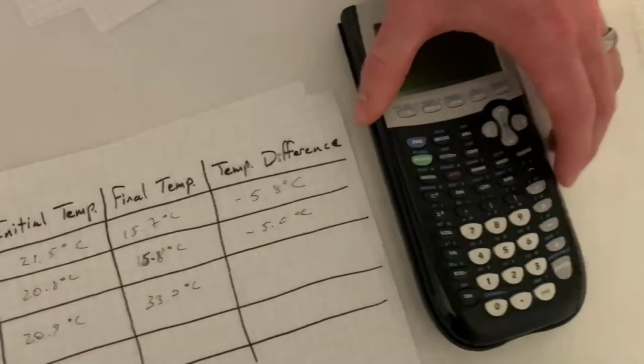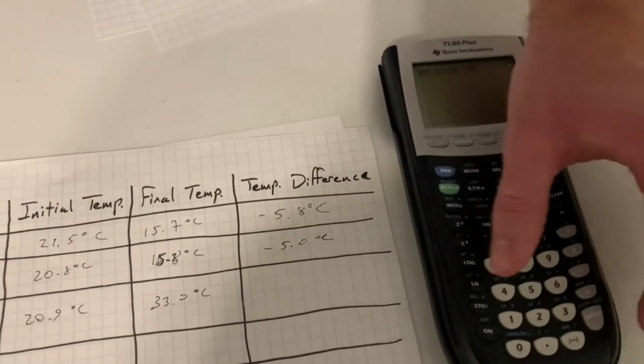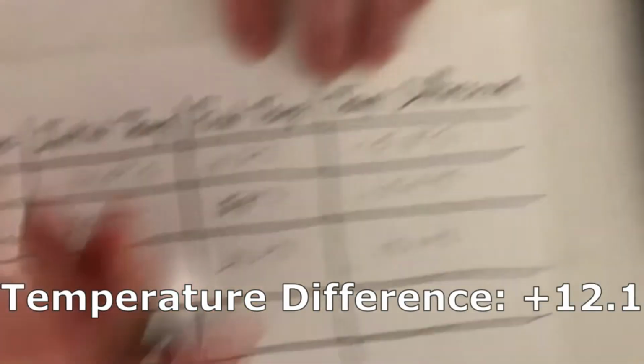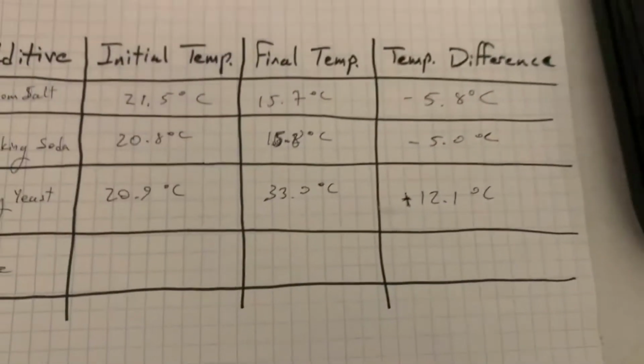So now we're going to take our calculator and we're going to do 33.0 minus 20.9. And that gives us a temperature difference of 12.1 degrees Celsius, a positive 12.1 degrees Celsius. So what does that mean? That means that this reaction is exothermic.